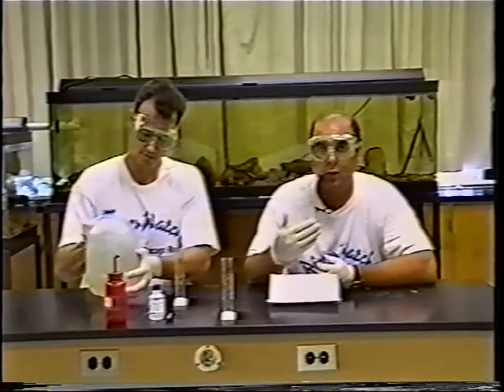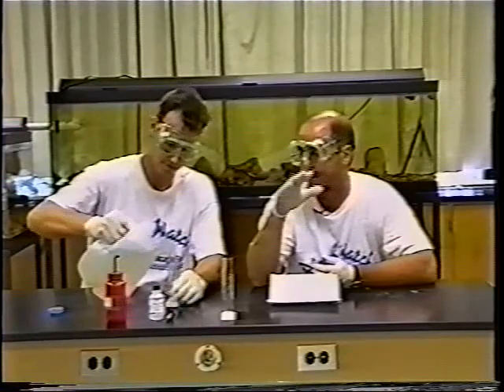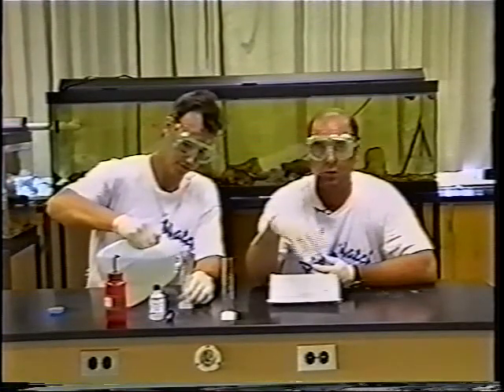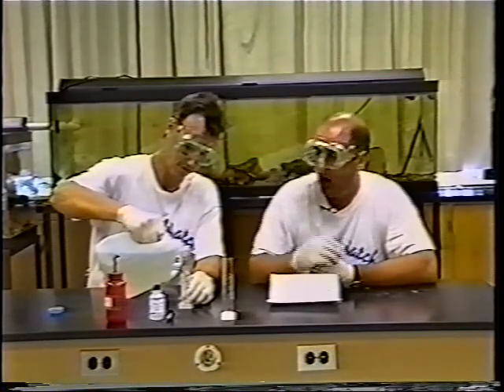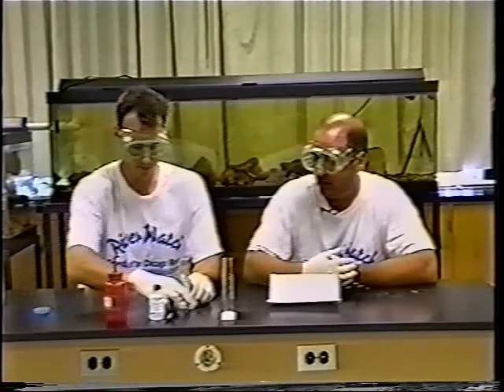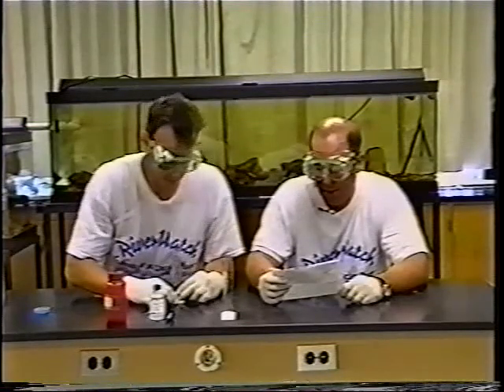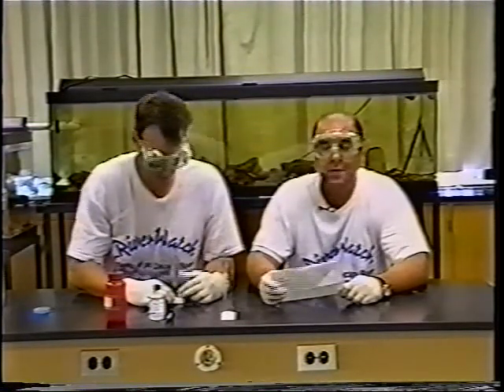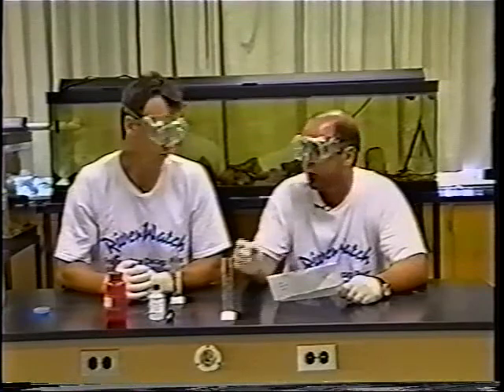Mr. Matthew is taking the water sample and swirling it around in case any of the solids or sediments causing turbidity have settled, mixing them back up as if stirred by the river. He's carefully filling the first observation tube up to the 50 milliliter mark. The very first thing he needs to do is look down the tube filled with river water and see if he can see the black dot. If he can't, he'll have to use only 25 milliliters of water instead.